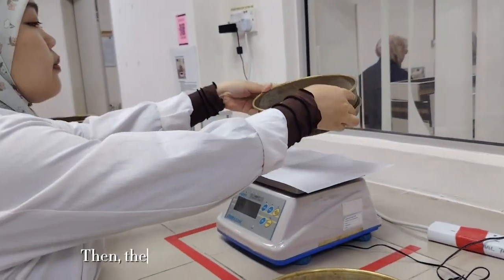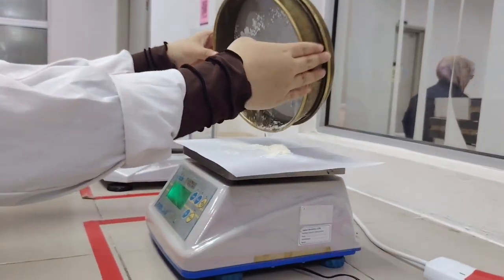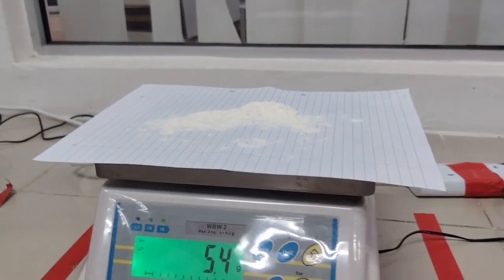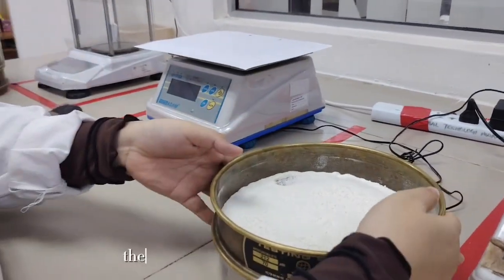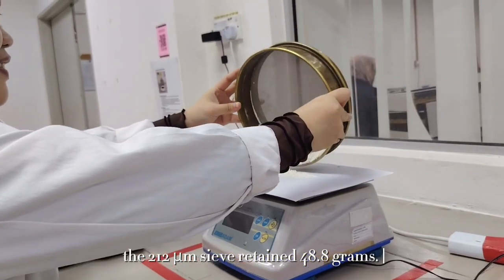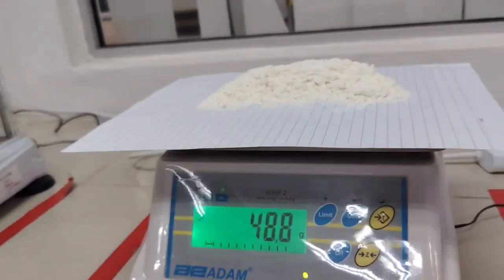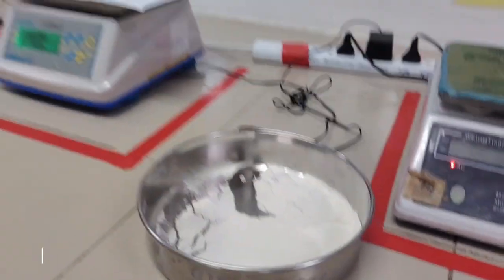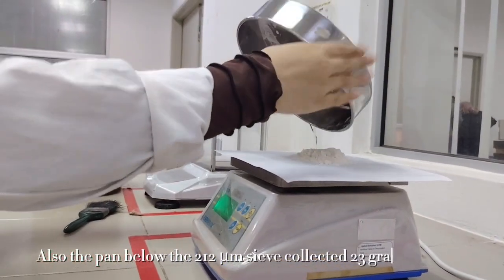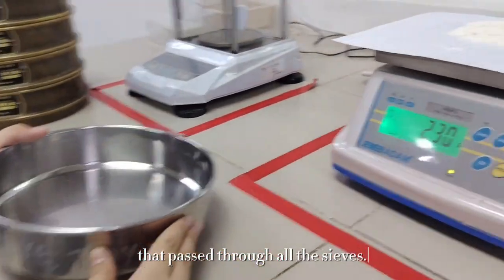Then the 300 micrometer sieve retained 5.4 grams of flour. The 212 micrometer sieve retained 48.8 grams. Also, the pan below the 212 micrometer sieve collected 23 grams of flour that passed through all the sieves.